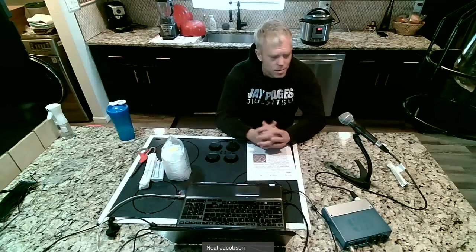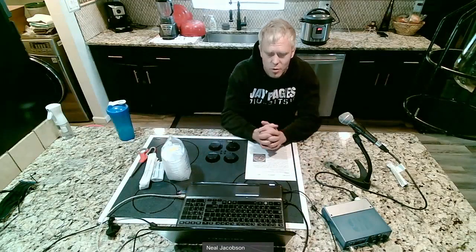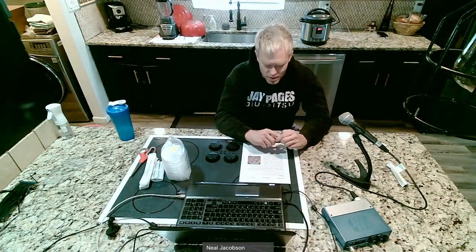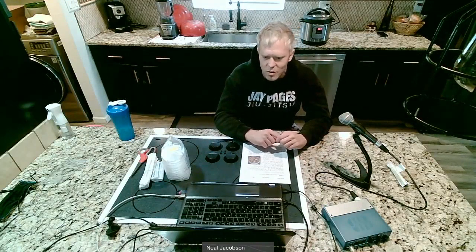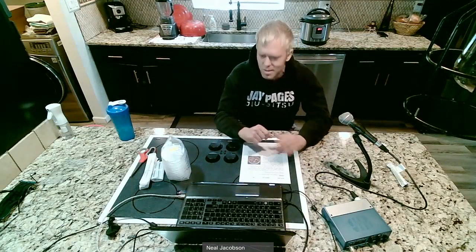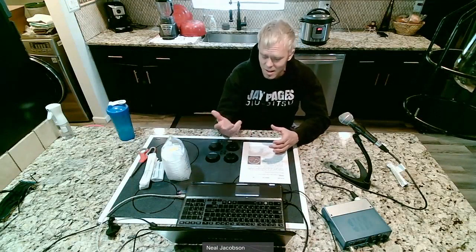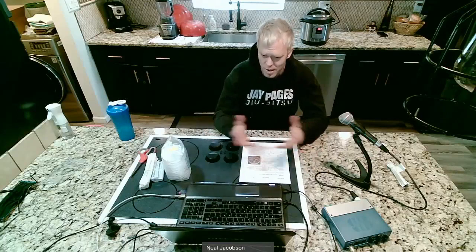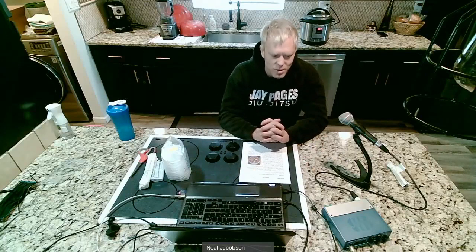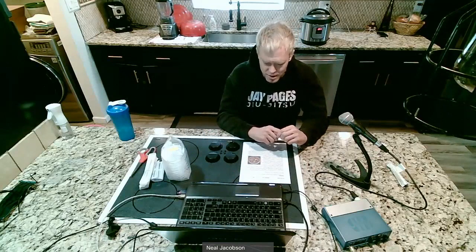Hi everybody, welcome to the bacteria lab. I'm redoing this lab for this semester because last semester I was making agar at home myself, and one of the things I realized was that agar is very prone to contamination — meaning when you're swabbing surfaces, just opening your petri dish and exposing it to the air and dust exposes it to all kinds of mold spores and bacteria spores. I wanted to redo this lab with more attention on how to prevent your dishes from getting contaminated.